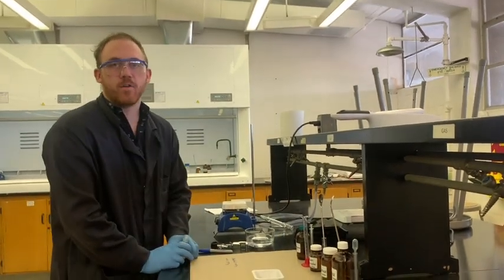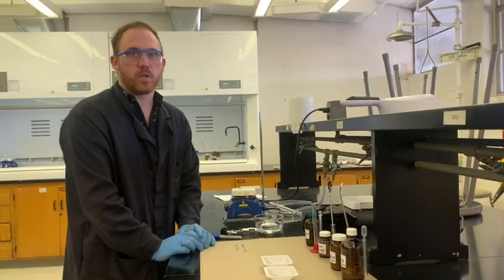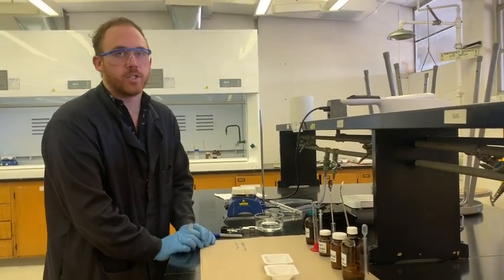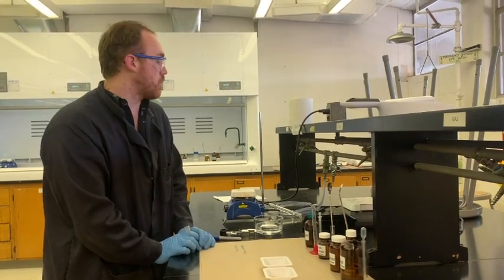And then drip back down. You want to make sure that the condenser is keeping all that solvent in, so especially if you're working with any kind of noxious or especially carcinogenic solvents, you always want to be working in a hood.